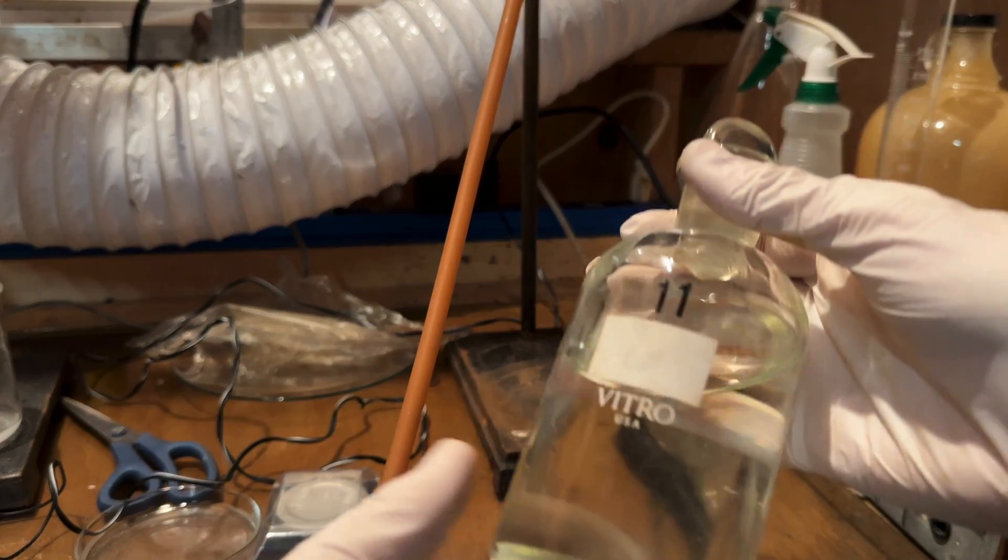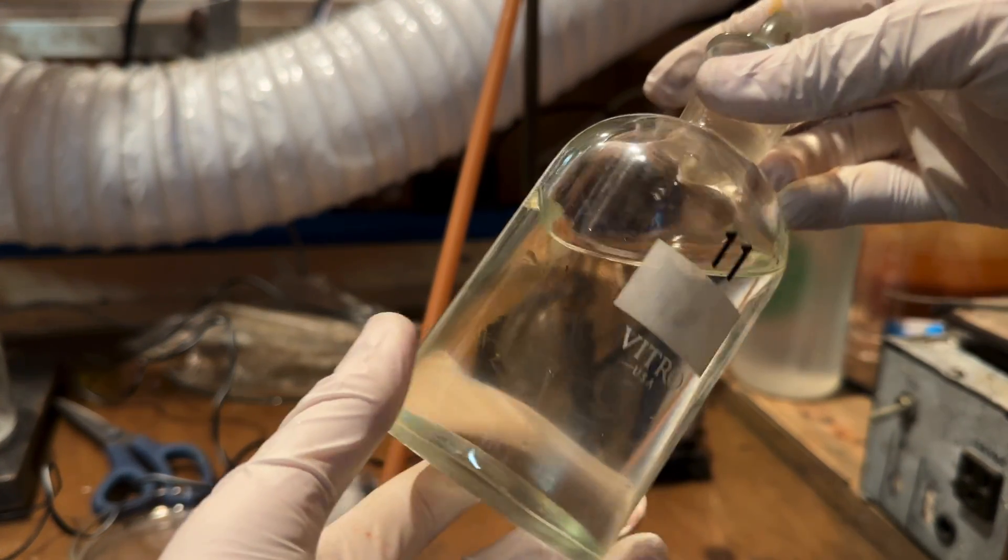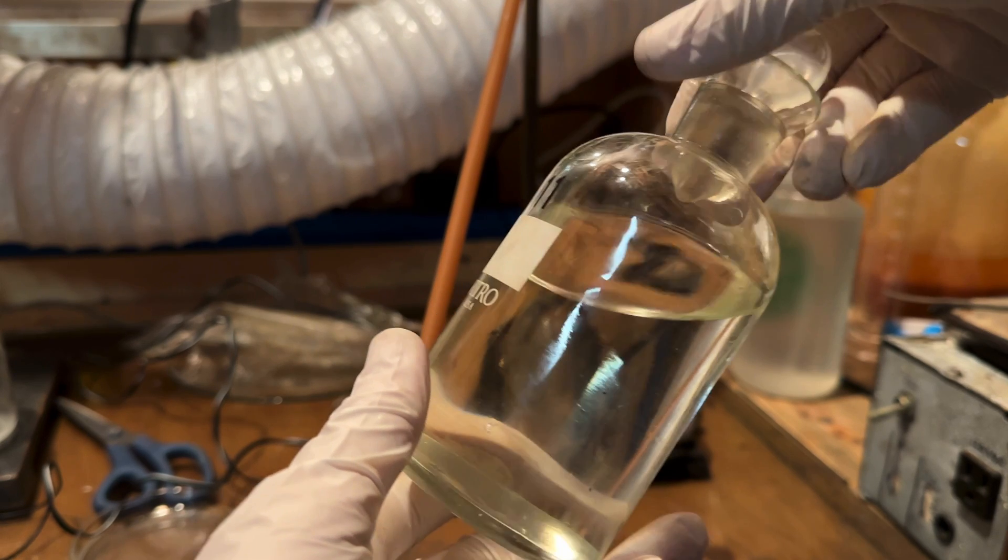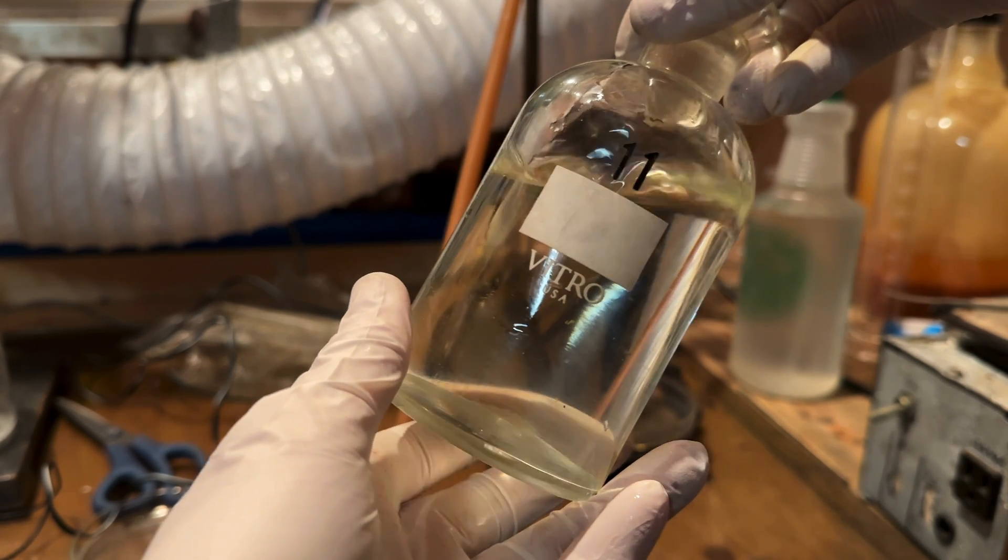This hydrobromic acid will be used in a future project to dissolve some beryllium oxide insulators. I hope you guys enjoyed this project, and I'll see you in a future video. Okay, bye.